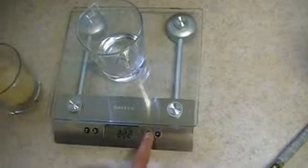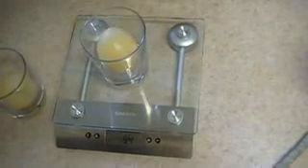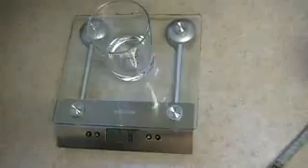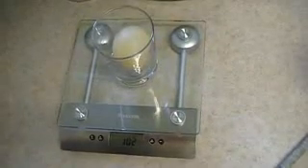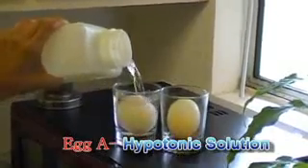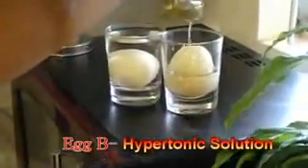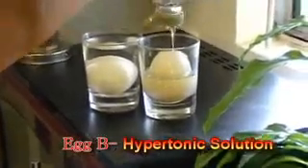Before starting our experiment, we will first mass our egg using a scale. Egg A has a mass of 94 grams. Egg B has a mass of 103 grams. Egg A we will place in a hypotonic solution, water. Egg B we'll place in a hypertonic solution, thick and sugary corn syrup.